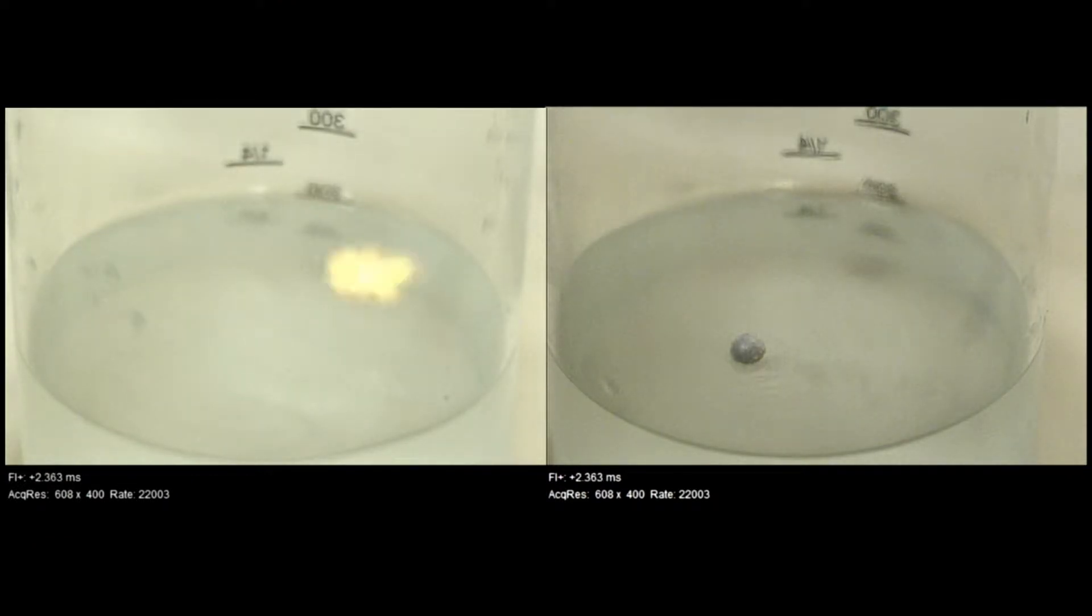And here you see the sodium explosion in a beaker of water. The water was hot, about 80 degrees Celsius. You can clearly see the Coulomb explosion of the metal and not the hydrogen that is exploding.